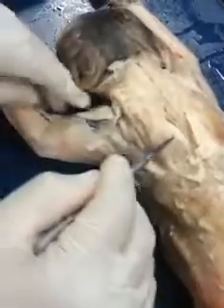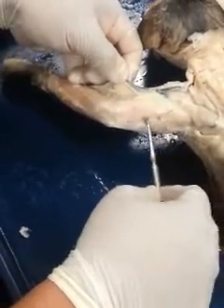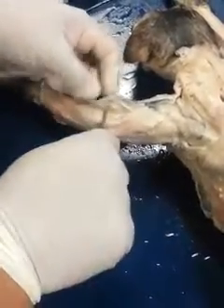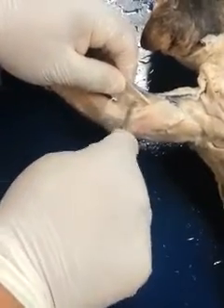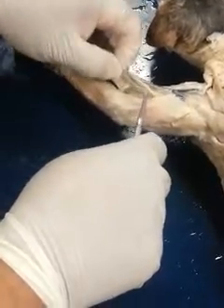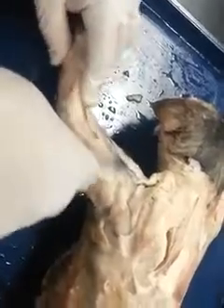Okay. As we move towards the brachium, on this dorsal side, the visible muscles are going to be the lateral head of the triceps, just this muscle here, the long head of the triceps, the brachioradialis, and the brachialis, just deep to that. So here's the brachialis, here's the rest of the brachialis. This is the radial nerve here. So brachialis, brachioradialis. And again up here you have your clavodeltoid.